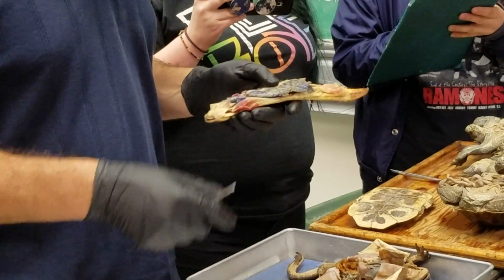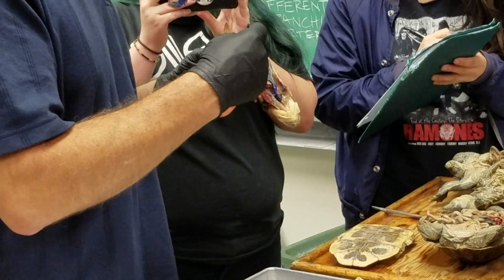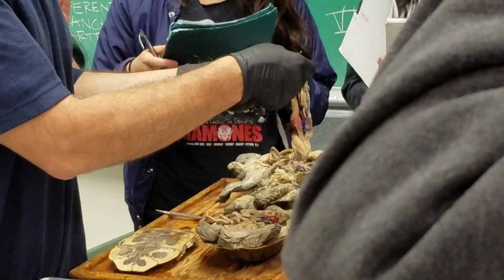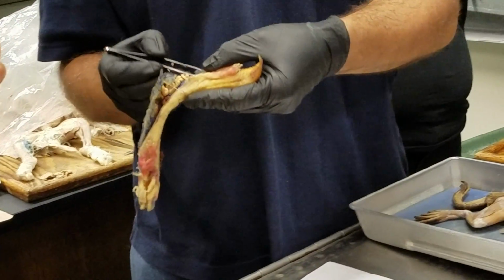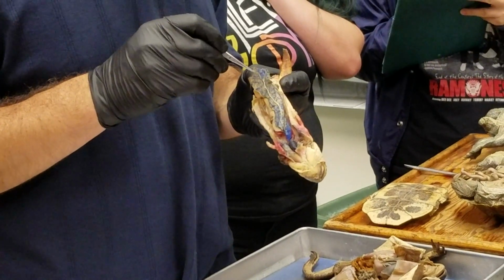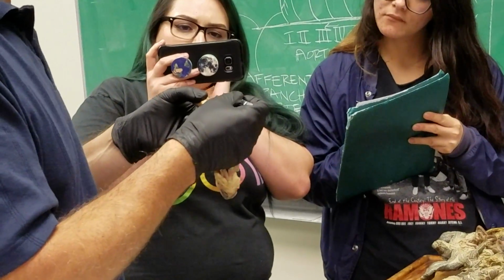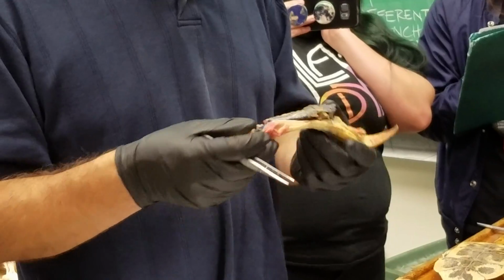Then there's the venous system in general. And something that a lot of people were struggling to find is the ventral abdominal vein, which is most easily seen running along with the bladder on the ventral wall of the abdomen right here. It's often not injected, and often kind of torn up, but you can see it right there. And the ventral abdominal vein, which is running along here, runs along the ventral side of the abdomen, but it also has a branch that dives down and connects to the liver, running through the falciform ligament. And that often gets torn, but you'll find a little fragment of it, often, even when it's been torn, right there at the back end of the liver, coming into the liver. And that goes into the hepatic portal system through the liver. Okay. And back eventually to the heart.